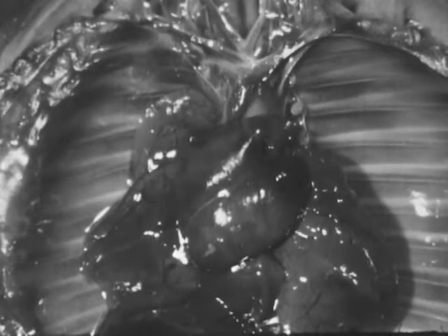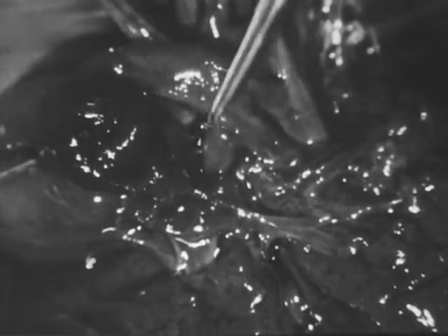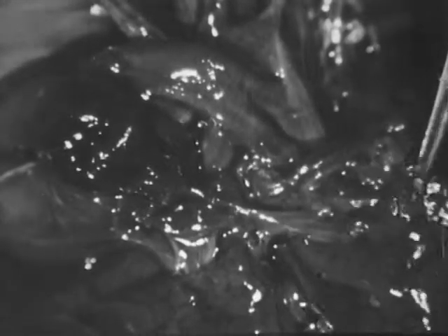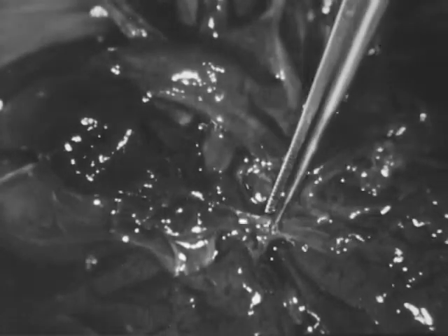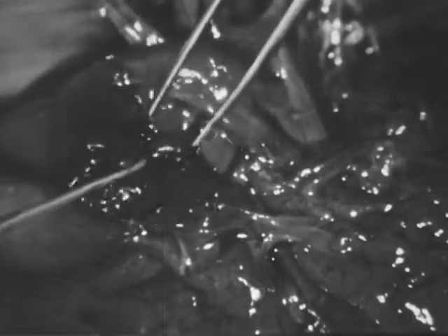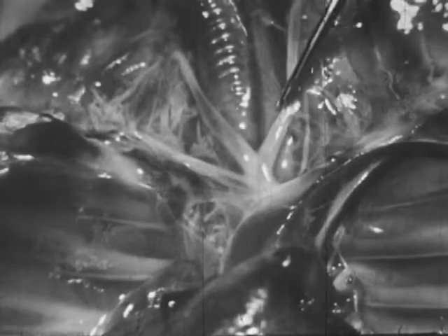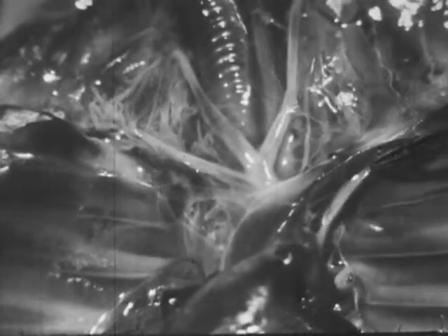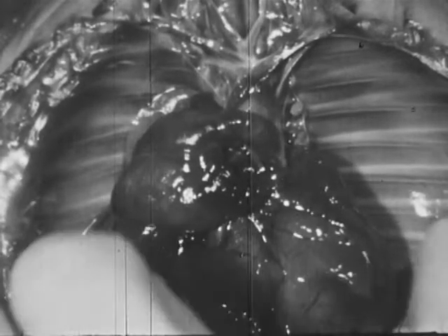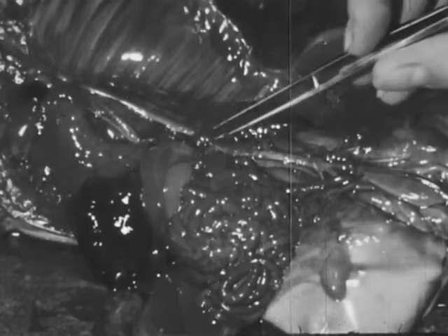We will examine the circulation of the blood as it occurs after the mammal is born. The right ventricle pumps the blood through the pulmonary trunk and pulmonary arteries to the lungs. Here, carbon dioxide is exchanged for oxygen. Then the oxygenated blood flows through the pulmonary veins and enters the left auricle. The left ventricle pumps the oxygenated blood through the large systemic trunk, from which branches are distributed. These are some of the branches which supply the upper part of the body. The descending aorta passes through the diaphragm and branches in the lower part of the body.